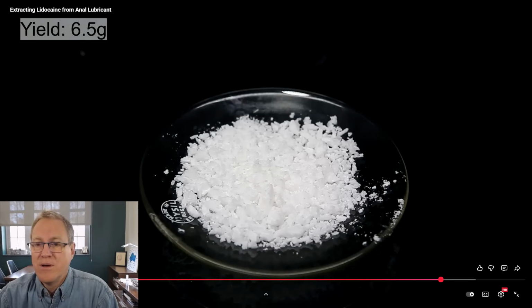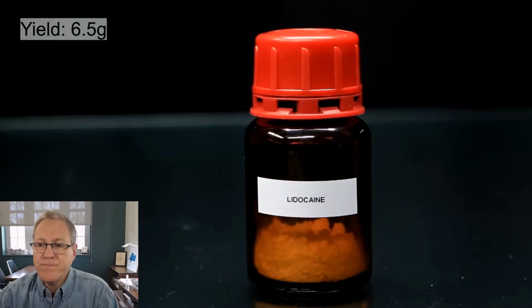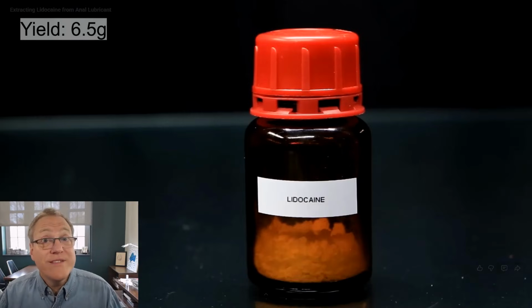In the morning, I was left with some pretty dry lidocaine, and when I weighed it, it came out to be about 6.5 grams. Unfortunately, I didn't weigh the lube before I used it, so I don't know what the theoretical yield is. Okay, well, let's think about this.